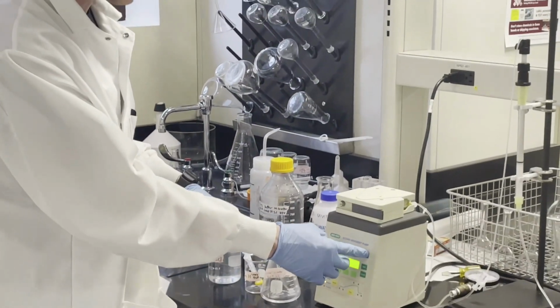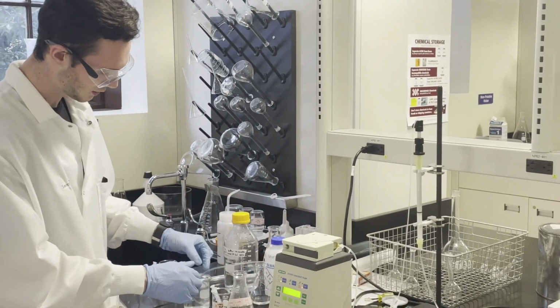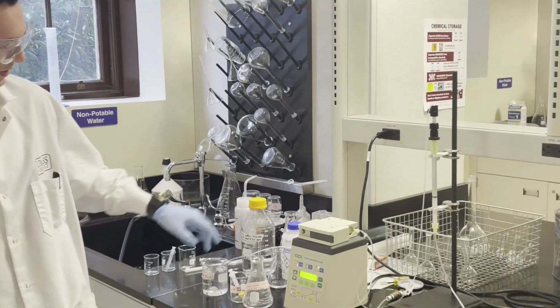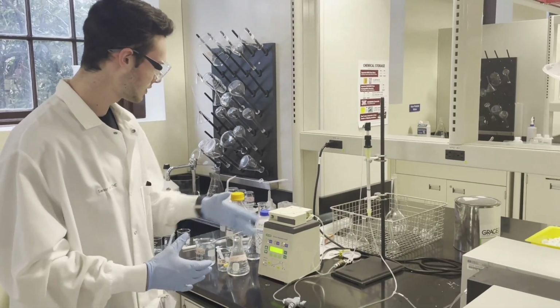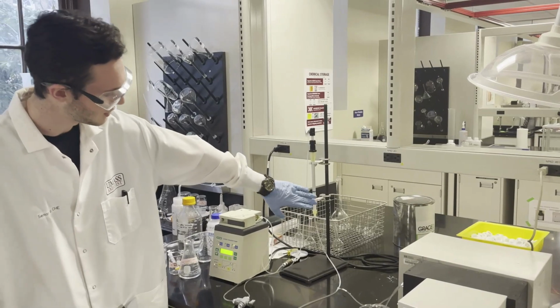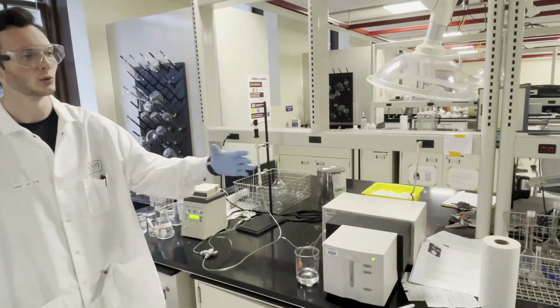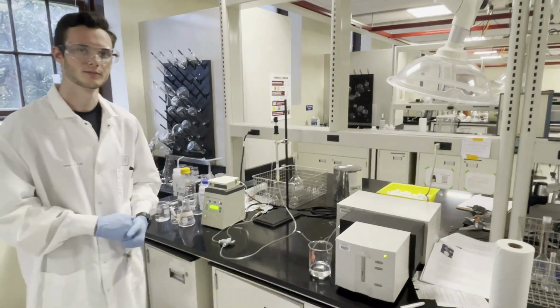So we're going to stop the pump, transfer over to this elution buffer, and simply turn the pump back on. And so now we're pumping the elution buffer through, and the negative charge of the chloride ions in the salt solution are going to kick out the negatively charged protein and force it down the column and into our UV-Vis spectrophotometer, where we'll be able to get the absorbance and therefore the concentration coming out.